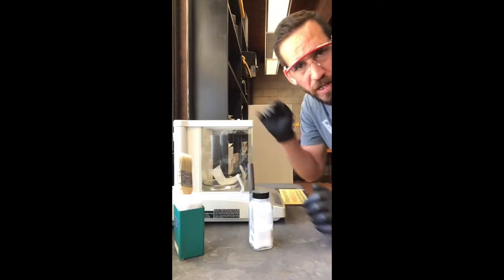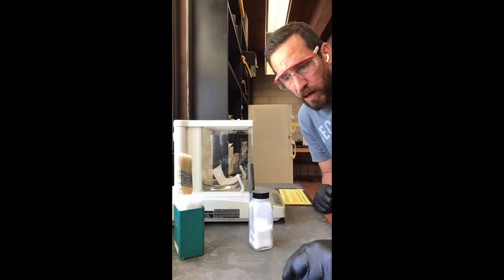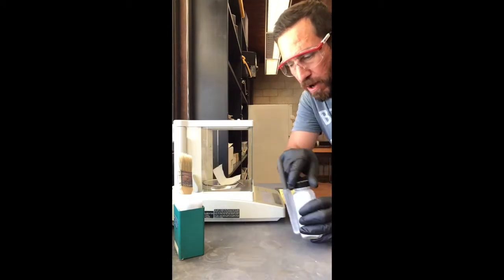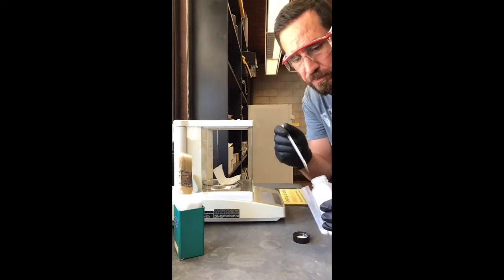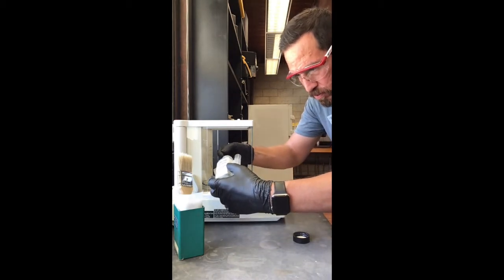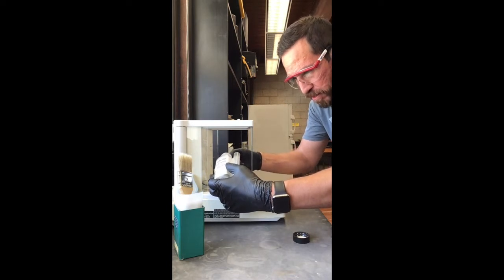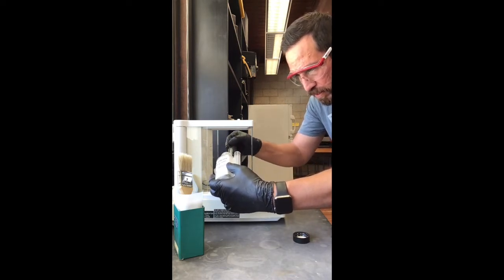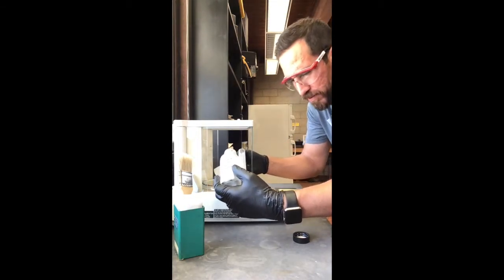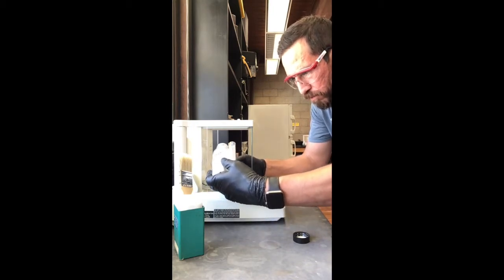We'll close all of our windows. I'm going to zero that, or tare it. Okay, and so now any caffeine that I add, that's how much we have on the scale. I'm going to put both arms through on either side just to minimize the amount of spill. I don't want to lose any caffeine, just in terms of saving the chemical, but also I don't want to have to clean up. I don't want to make a mess. So this is way too much. I only need 0.070. Okay.